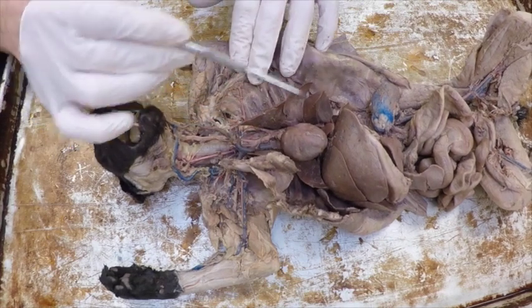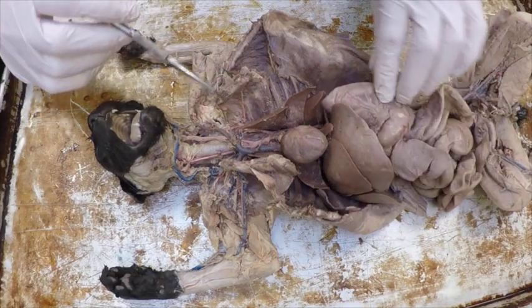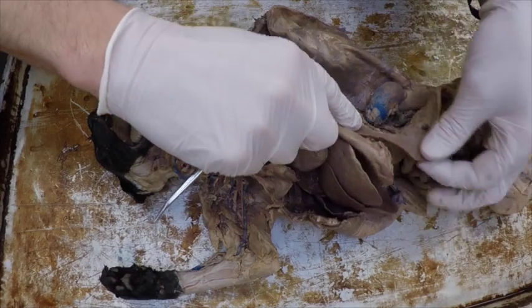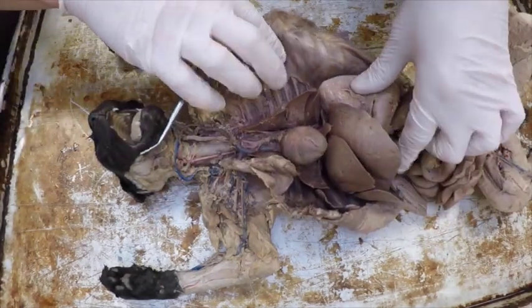The easy structures, I think, are the lungs, which surround the heart. In addition, you have the spleen, which is right down here. It's right kind of by the stomach. Almost looks like a tongue. So that's the spleen. You have kidneys on either side that you can say.